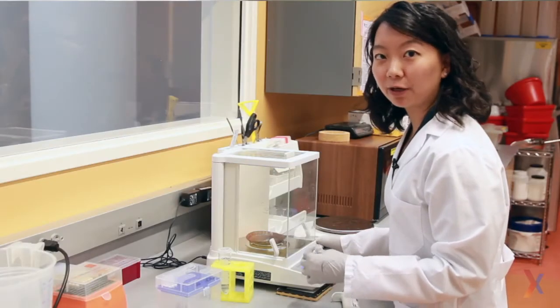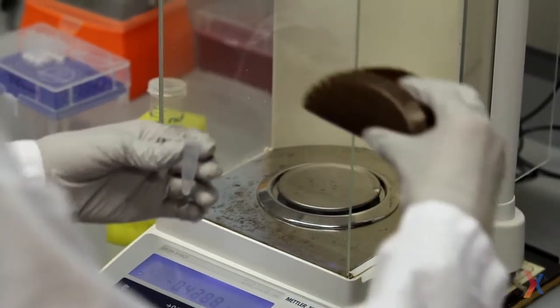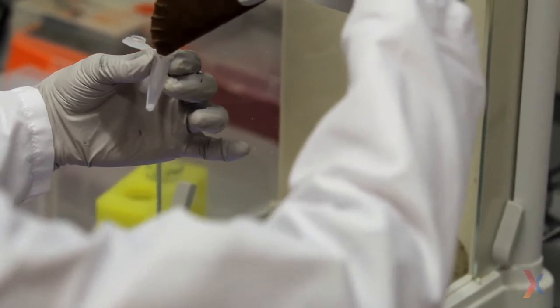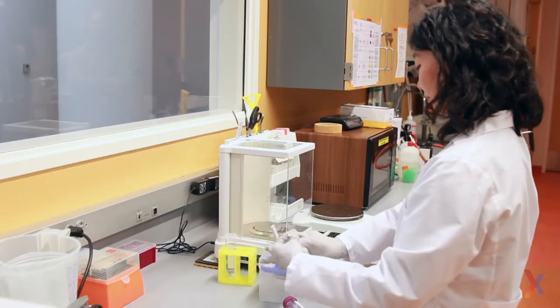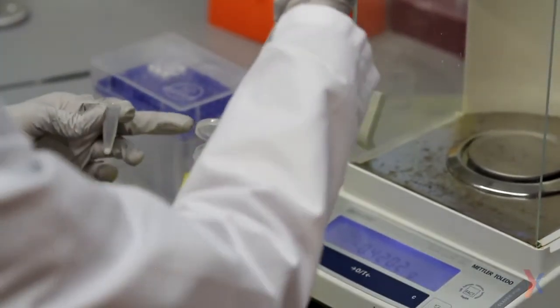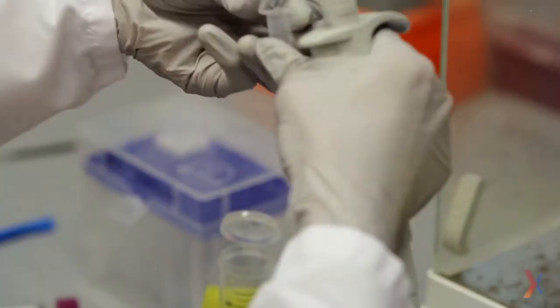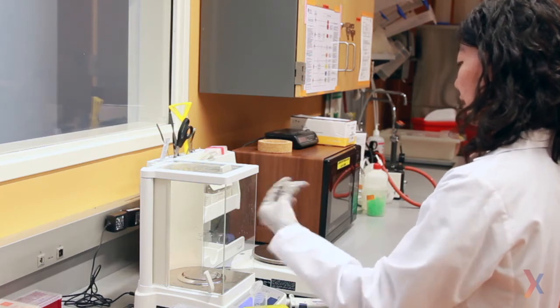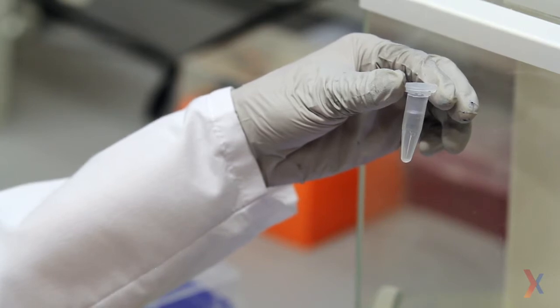Now that I've weighed out the appropriate quantity of sodium chloride, I can take the weigh boat, gently pinch it to create a spout, and carefully pour it into this Eppendorf tube that I've prepared. Then I can take my pipette and pipette in 1 mL of water, because my final volume that we calculated for was 1 mL. I close the cap and shake it a few times to get the sodium chloride to dissolve. And there you have it — we've created a 1 molar solution of sodium chloride.